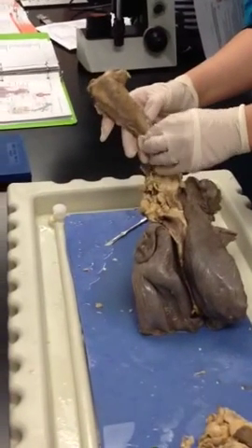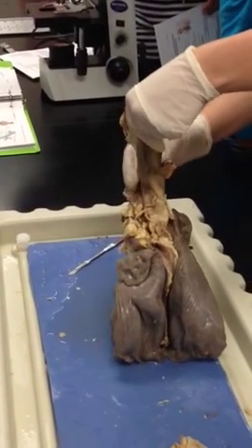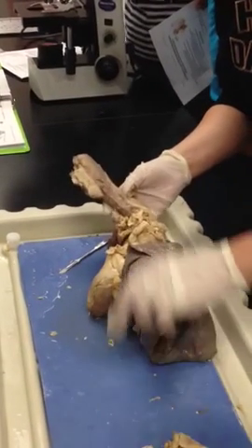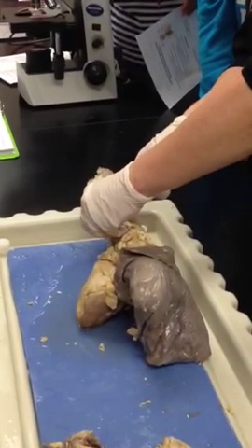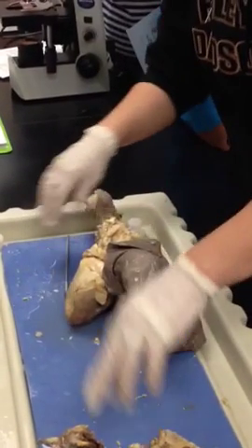So what is the trachea made out of? What tissue is it made out of? It has cartilage in it, but what's the epithelial tissue? Not that you're going to see it on this, I'm just quizzing you. It's what? Wow. What epithelial tissue is columnar. Alright, good job. Okay.